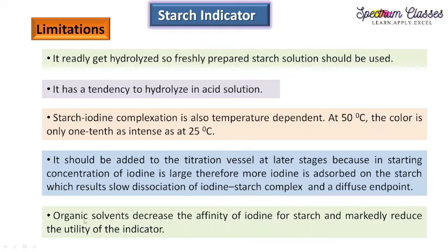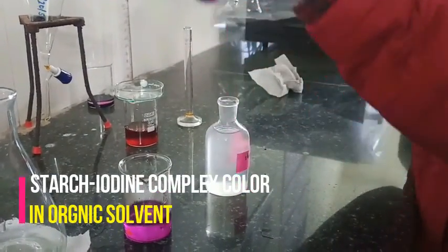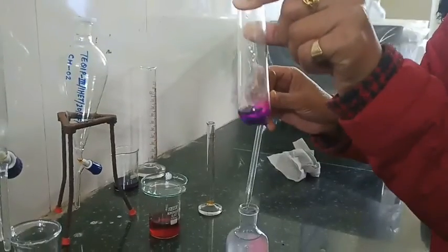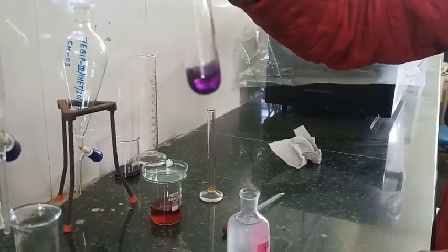Apart from this, organic solvents decrease the affinity of iodine for starch and markedly reduce the utility of the indicator. Here I am showing you this. Here I have iodine in hexane, and in this I am going to add the starch, so you can see how this starch will give the color in the organic layer.